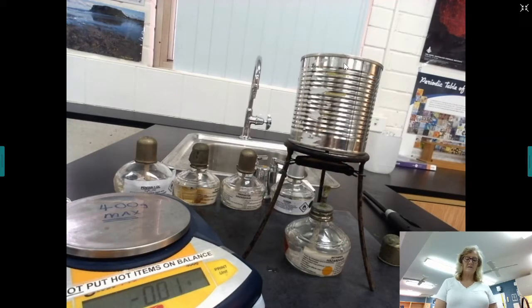So I will be demonstrating this for methanol, and then I will just be giving you some data for the others. So I will do it 5 times for methanol, ethanol, propanol, butanol and pentanol, but there's no point in you watching me do the same thing 5 times. So I will just video myself doing this once, and then I will present you the data so you can do the remainder of it. So you can do the analysis based on the data for the 5 different alcohols.